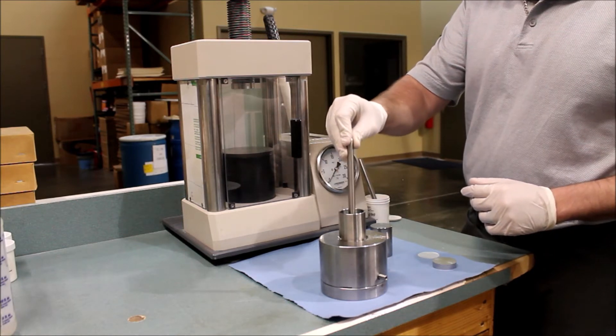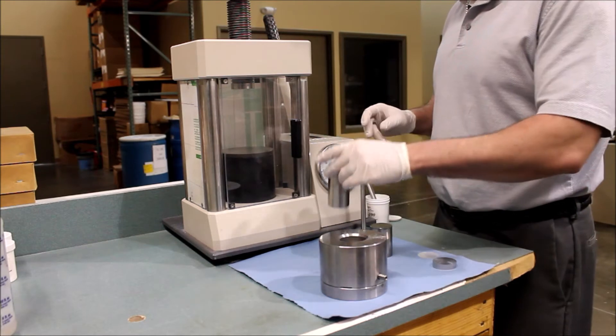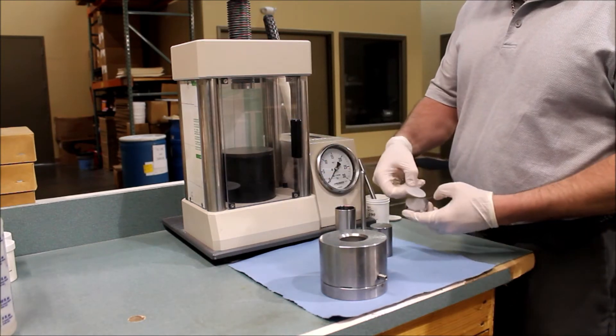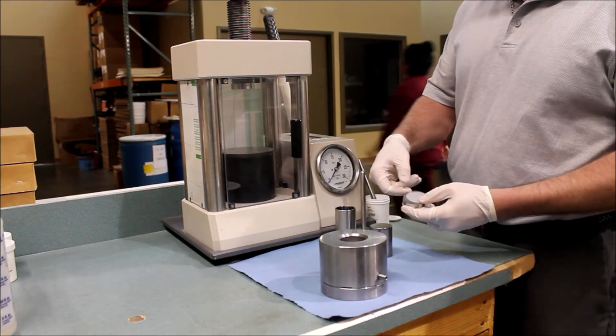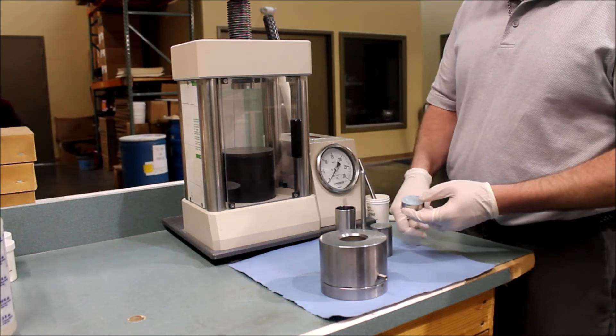Remove the pellet filling tools, as seen, and place the pellet film across the second puck. Insert this into the bore, taking care not to jam it.